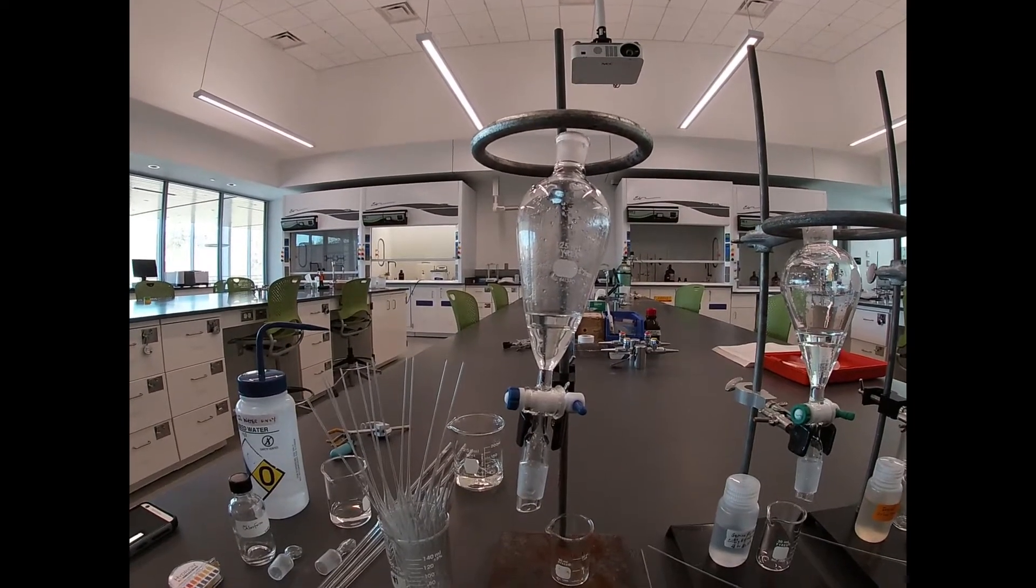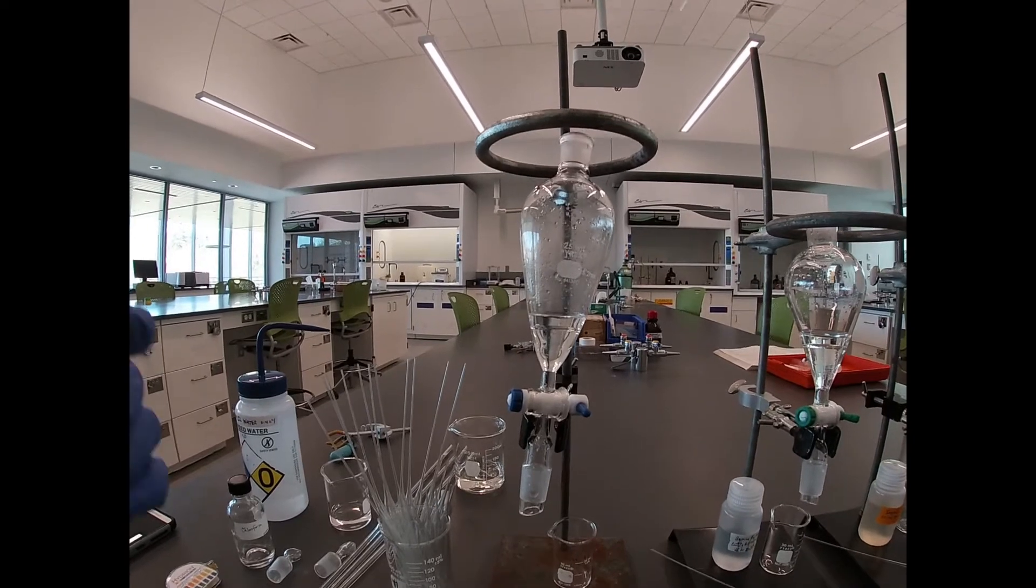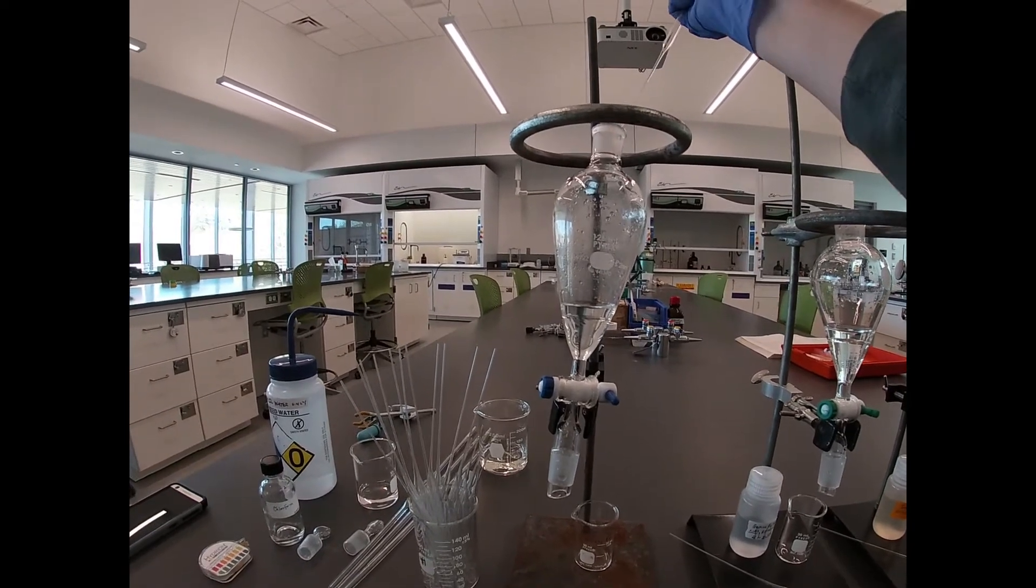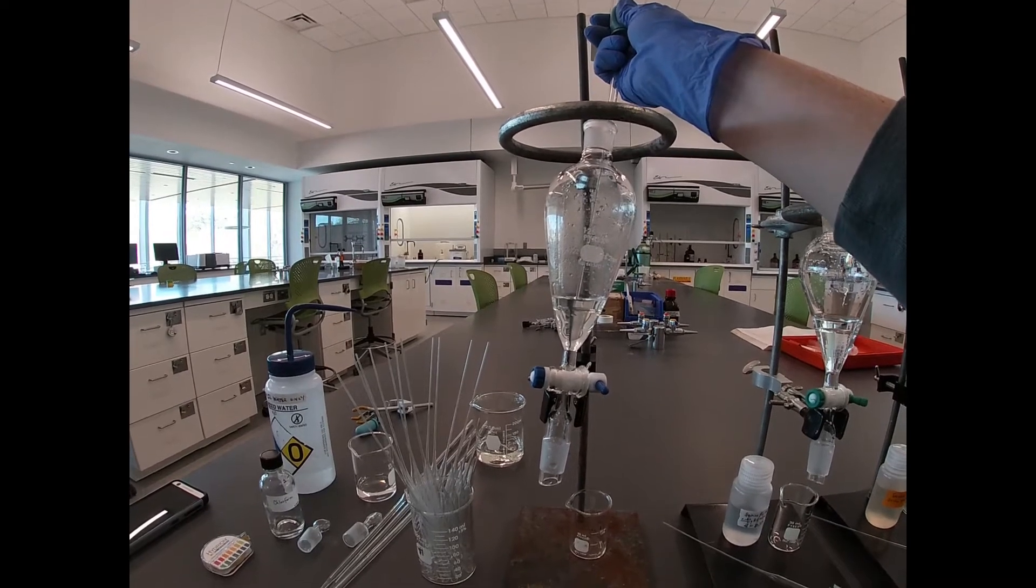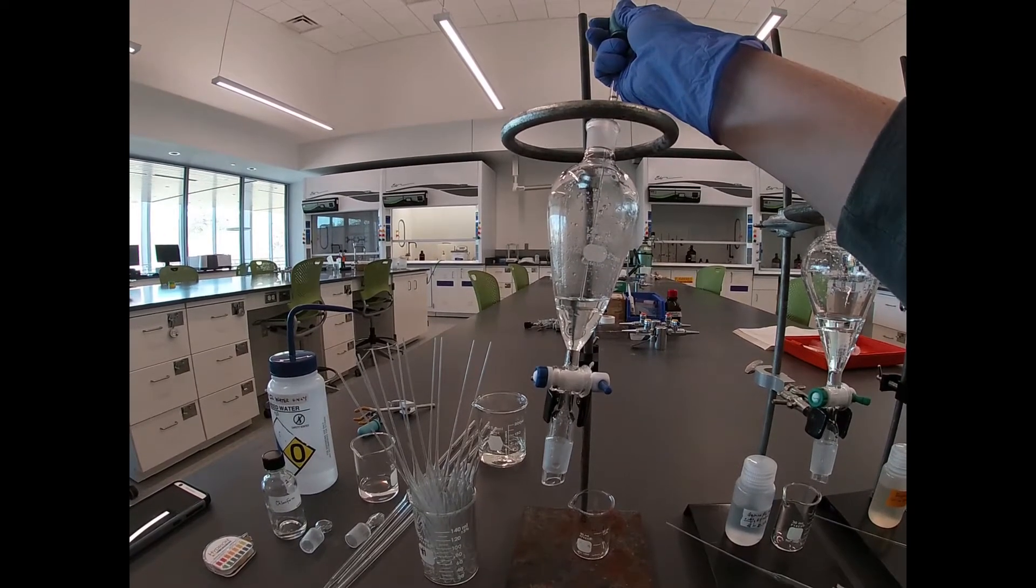So here we are to do our extraction of the top layer, the sulfuric acid layer. We want to separate that without actually getting any of our chloroform layer.